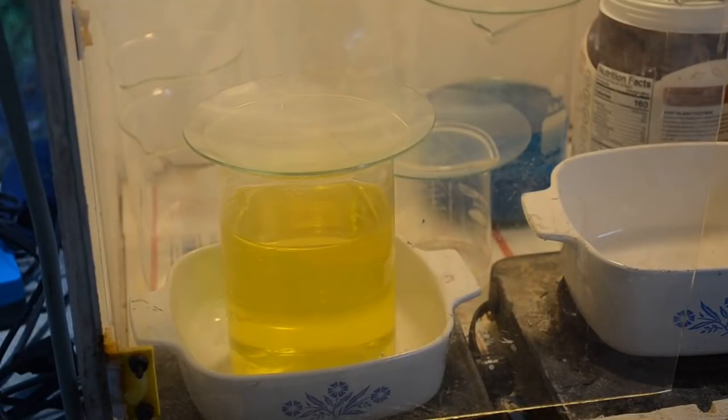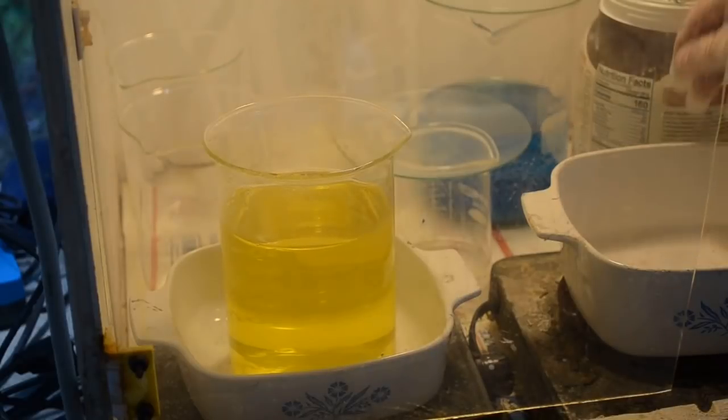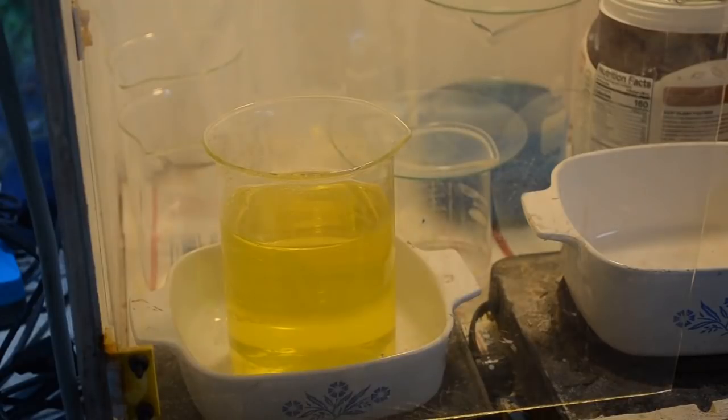Alrighty, the liquid has been double filtered. It's quiet here at the farm for the moment, but this probably won't last. Let me see if I can get this gold dropped before the noise starts up again.